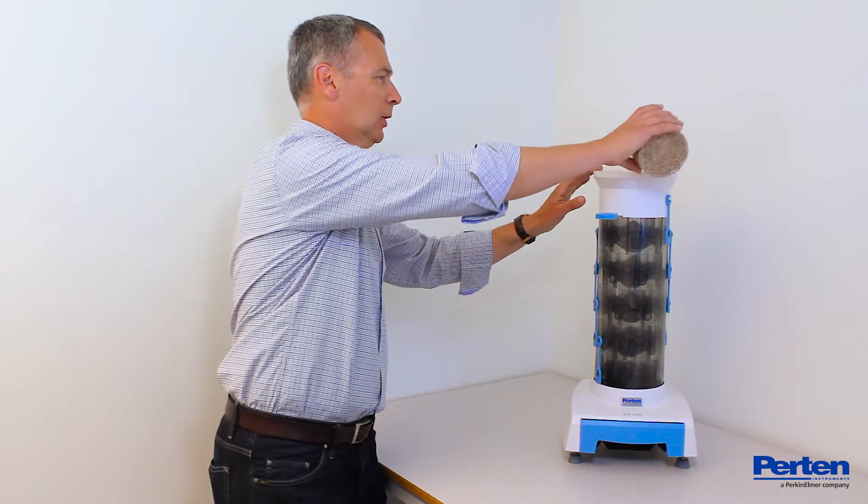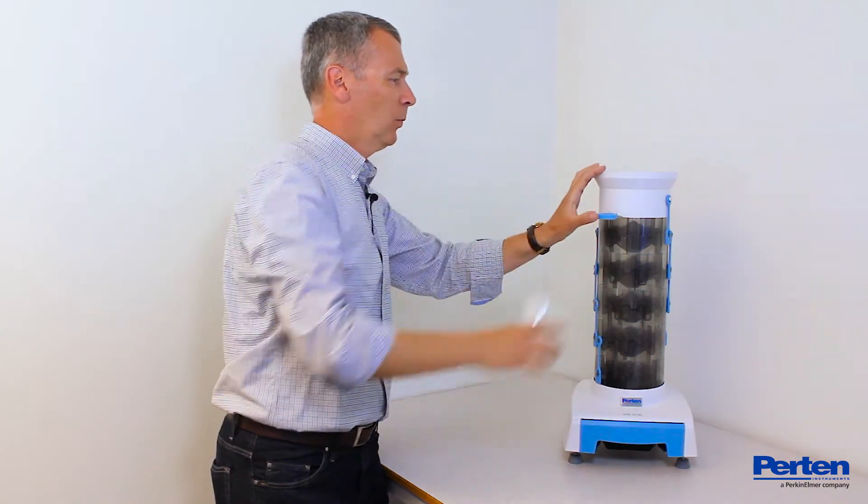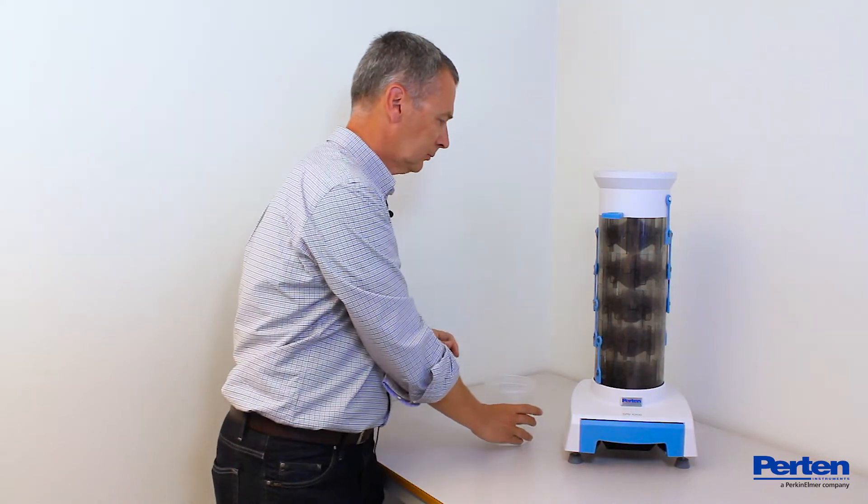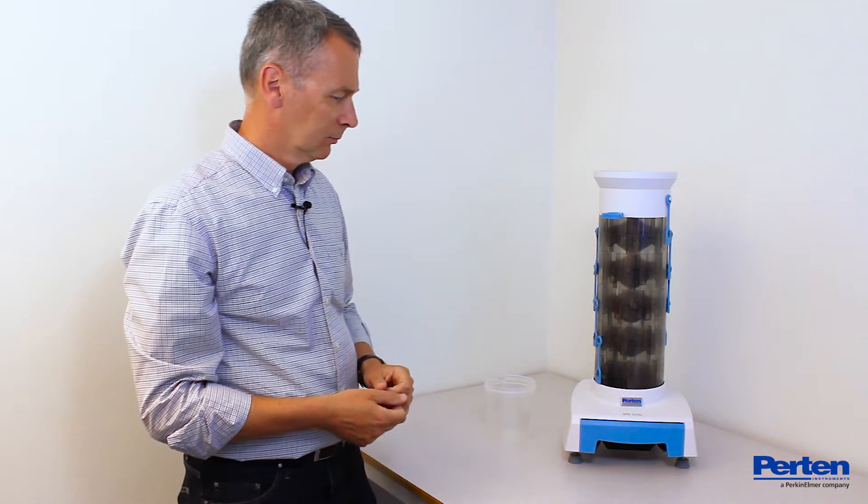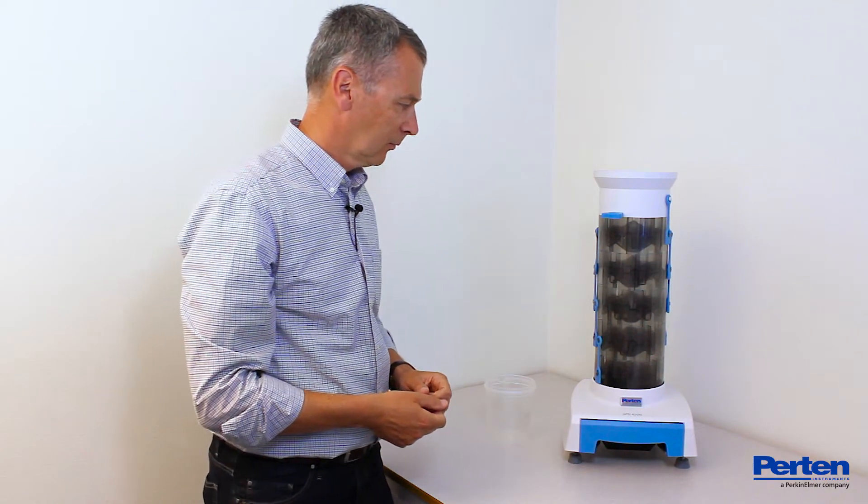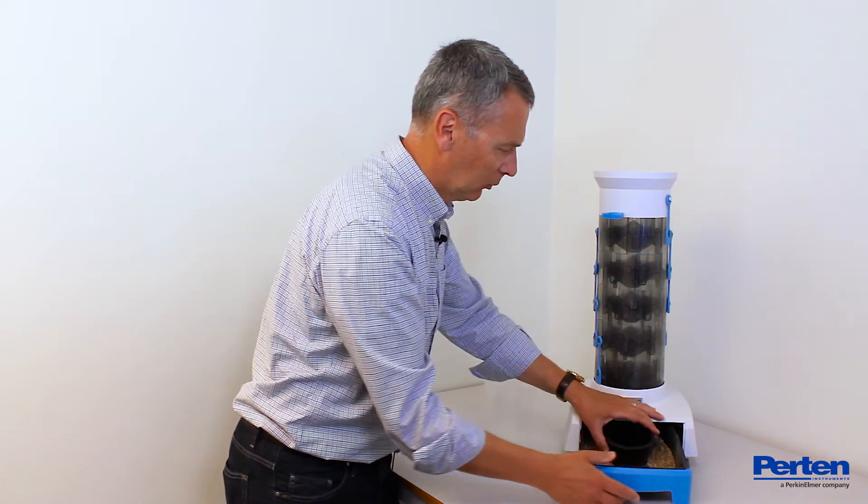Simply pour in the sample into the top and open the shutter. When ready, take out the sample from the tray.